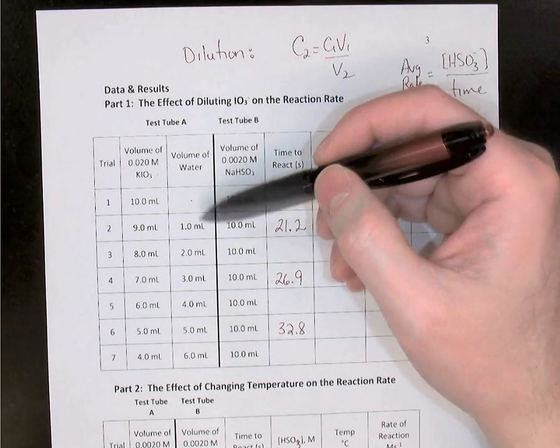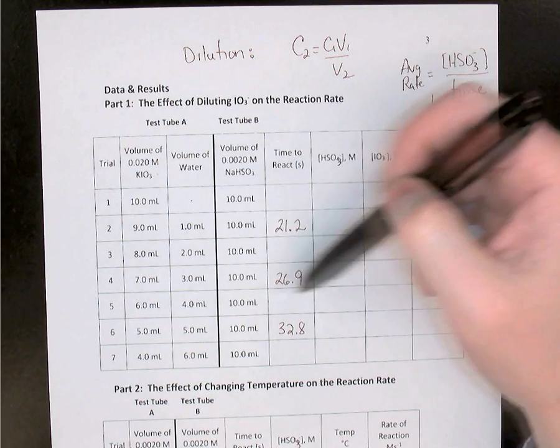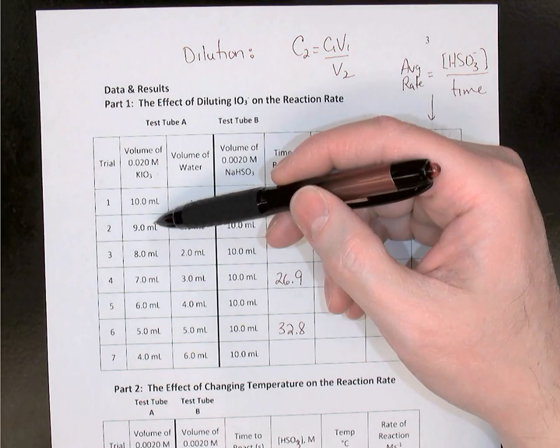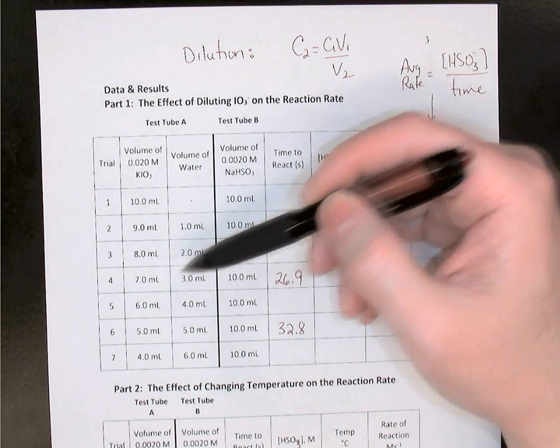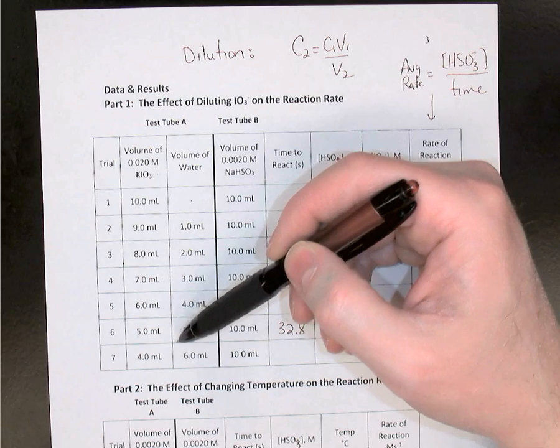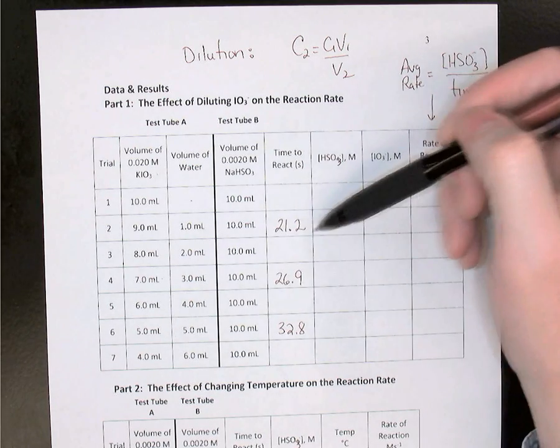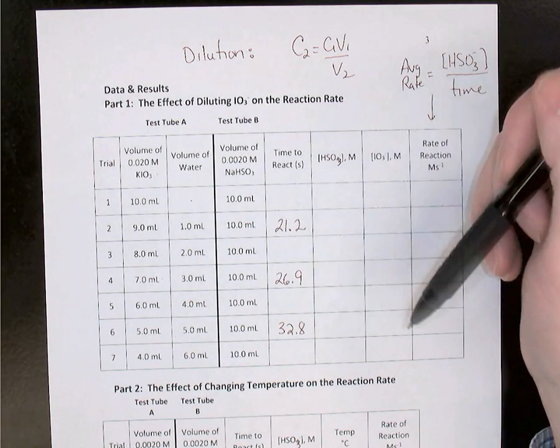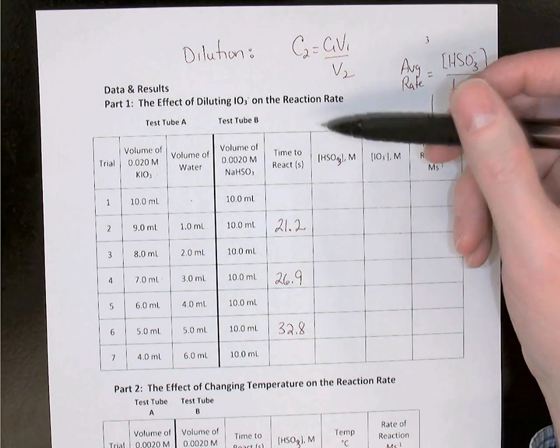I've done a few extra trials for you. I've added in 9 mL, 7 mL, and 5 mL. So I want you to copy these times into your data table and add them to your data.